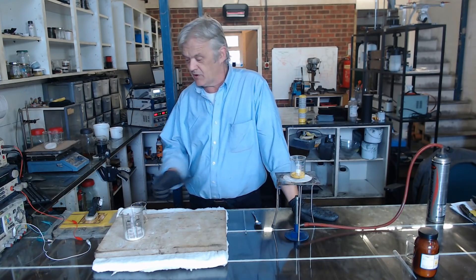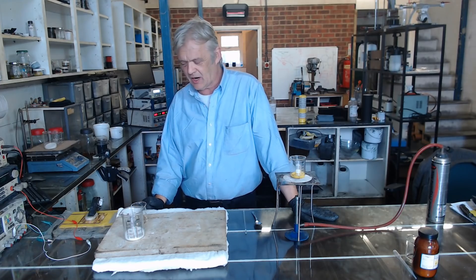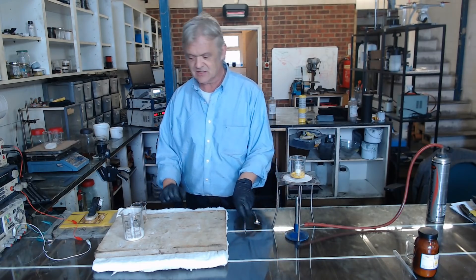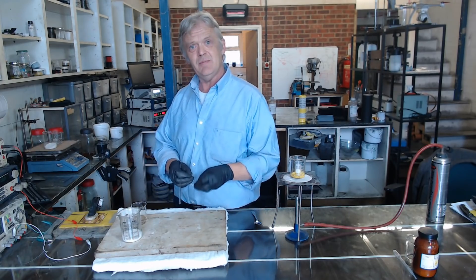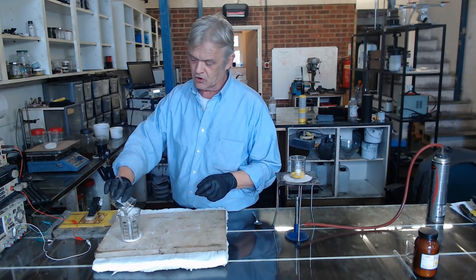The first one I'm going to start with is a really well-known reaction that produces a carbon snake. Here we have 50 grams of normal table sugar and 30 millilitres of sulfuric acid. If I pour that sulfuric acid into the table sugar, a carbon snake will form. It doesn't happen immediately — it takes a little bit — so I'm going to add it, give it a stir, and talk about it a little bit.